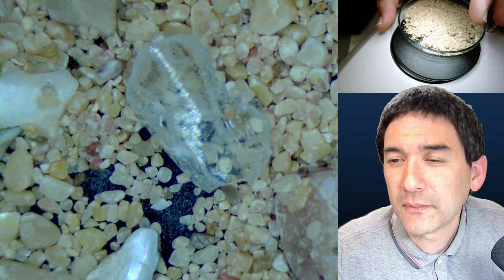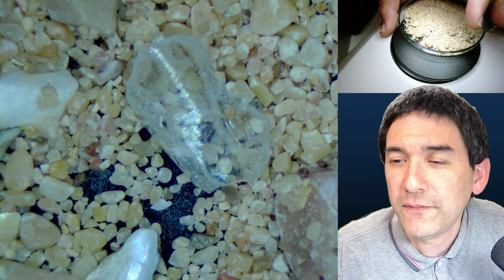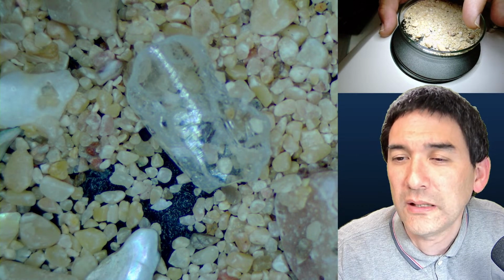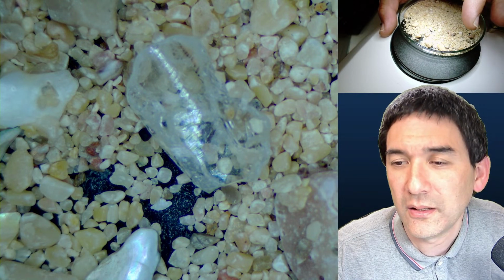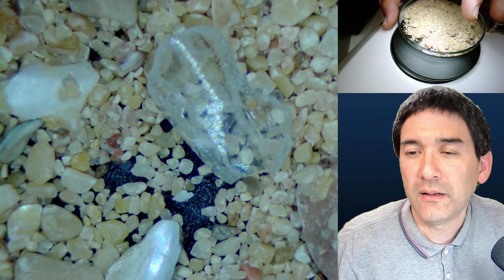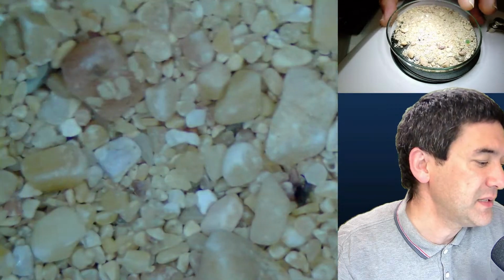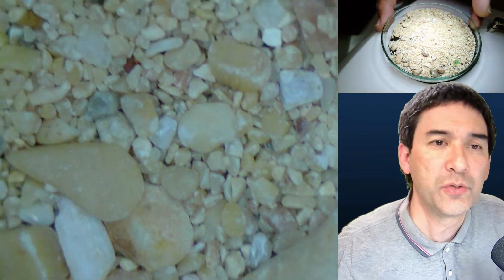So, okay, thank you. I think the 30 times was over marketed and it's actually 15 as it's only a cheap eyepiece. Okay. Yeah, opal. I don't know. Maybe. But in any case, that's something that one could also observe.